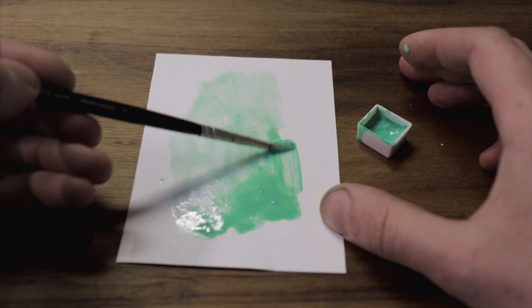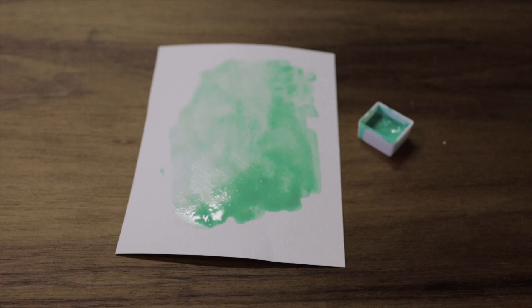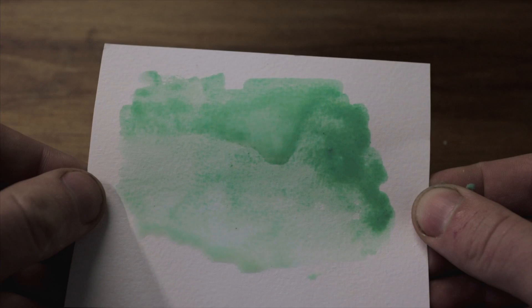You can go from quite a rich greeny color to a very transparent, pale, gentle lime-mint green — very much reminiscent of some parts of a malachite crystal where you get lighter striations of green coupled with much darker greens. So that's what we're looking at: you can go from that deeper tone right through to that gentle pale. It was a relatively quick and simple process, particularly in comparison to how complex and long the blue verditer was. Making the green variant is a lot easier, though there's a lot of improvement I could do — I really want to know how to get those deeper tones you get in malachite crystals.